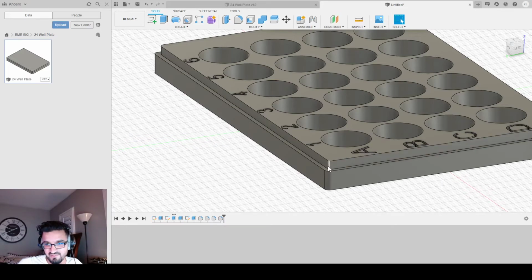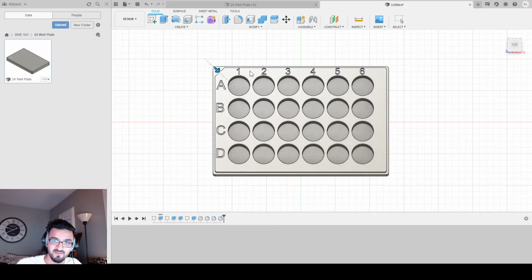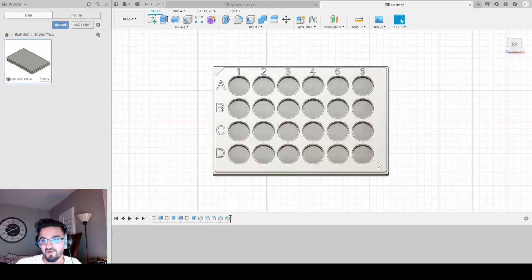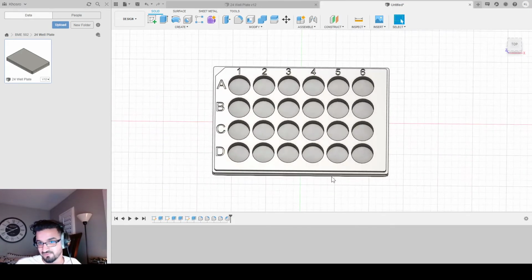And we're going to do that here by just selecting this corner, going to modify and chamfer. And we're going to drag this in by 7. And that'll give us that nice cut here. Why did I pick 7? That's because it's the dimensions I was given. You could always go sharper if you want, or not as sharp. I'm choosing to go 7 because that's what my design is, basically. I'm going to click OK. And there you go. You have the bottom 24 well plate all nice and ready for you to use.